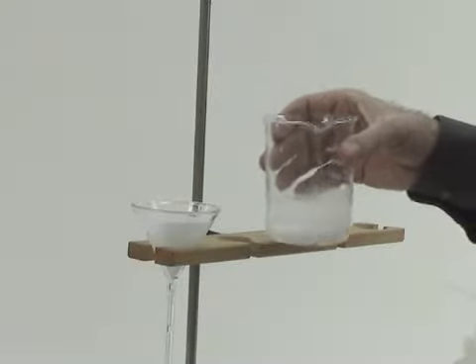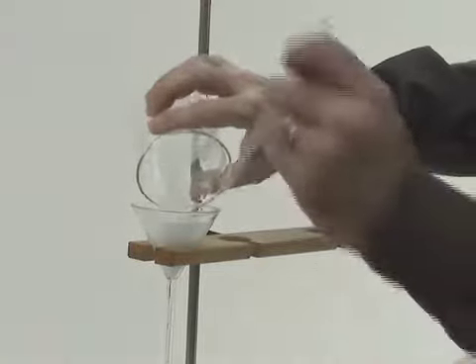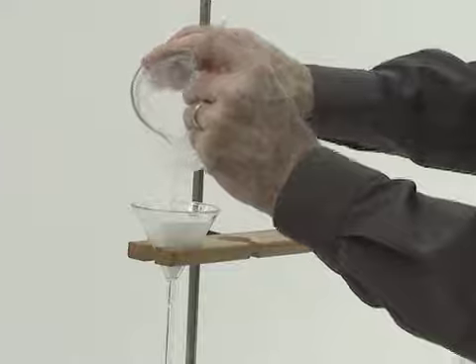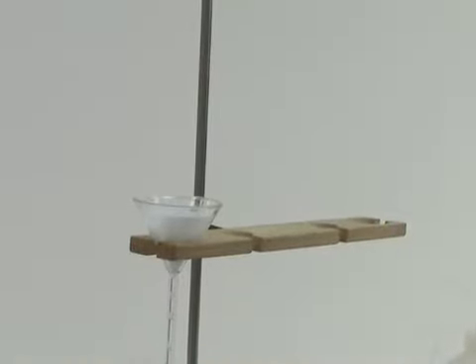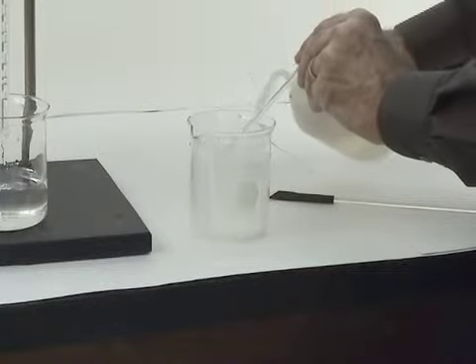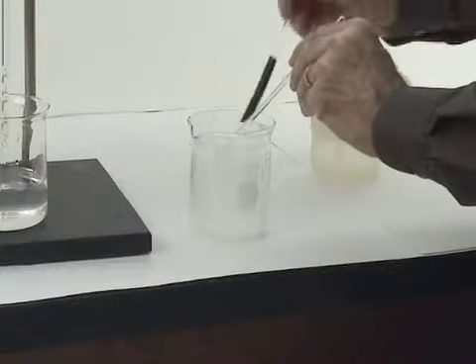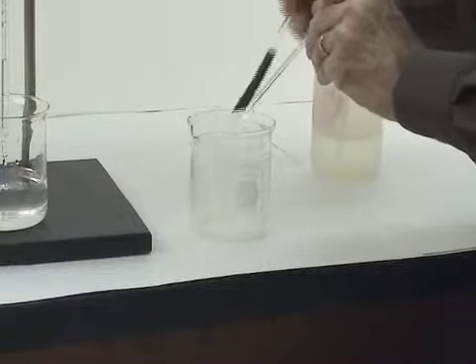We next want to transfer as much of the precipitate as possible in one smooth pouring motion. Use the stirring rod to remove any drops from the lip of the beaker. Repeat this process until all of the loose precipitate has been transferred to the filter paper. When that task is completed, the only thing that remains is to scrub down all the glass surfaces where precipitate might be clinging. We do this again with the aid of the rubber policeman.